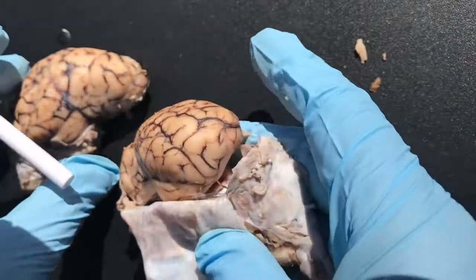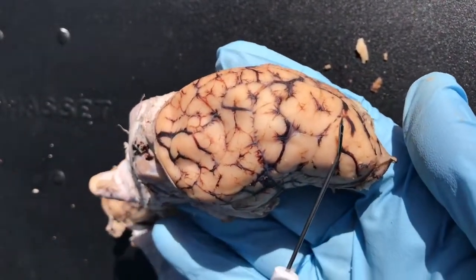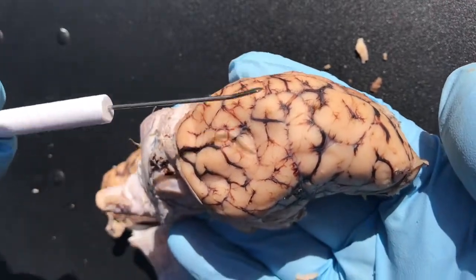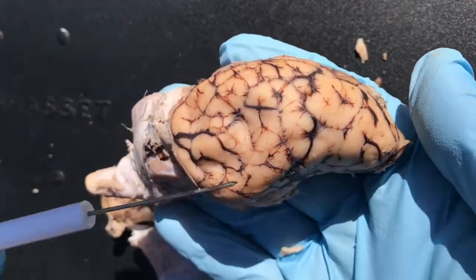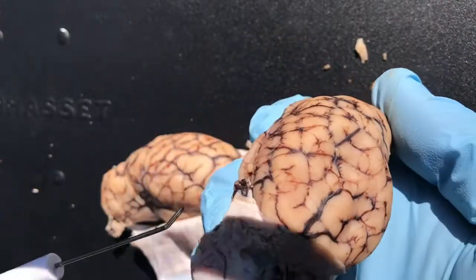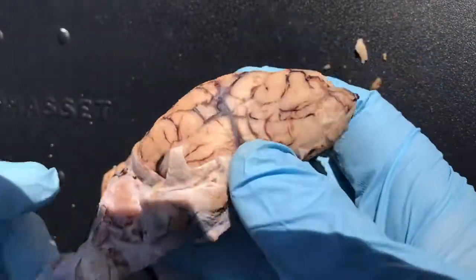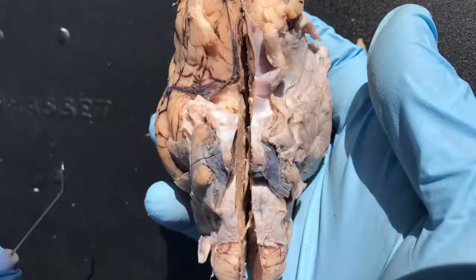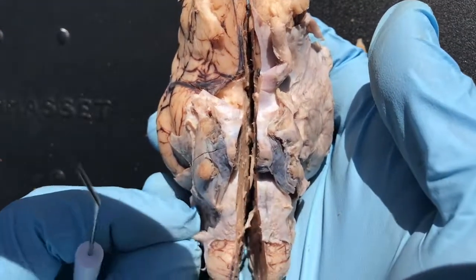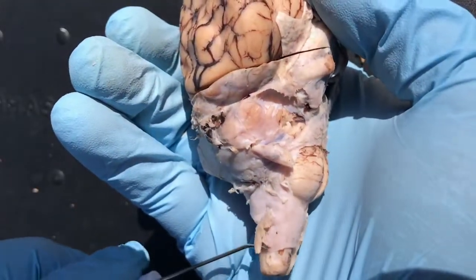And of course, you have your lobes. You have your frontal lobe, parietal lobe, temporal lobe right here, and the occipital lobe posterior. Very nice. Of course, there is more to the brain — you have all the cranial nerves. They're a little hard to see on here. Here's an accessory nerve.